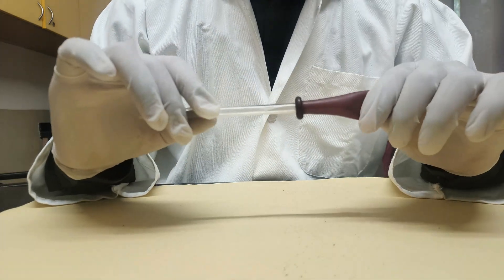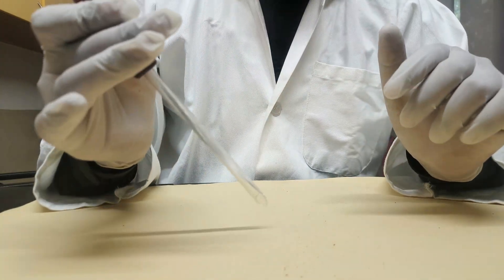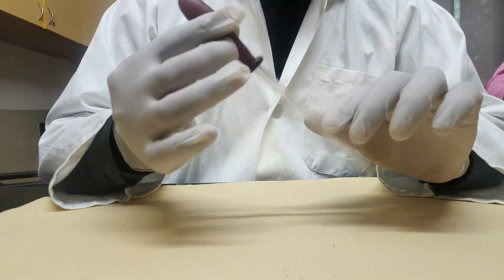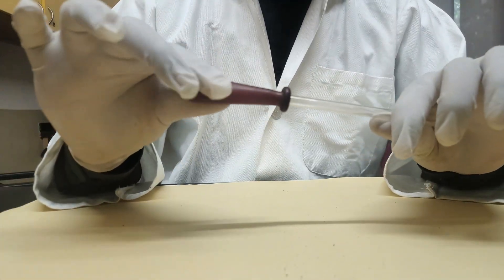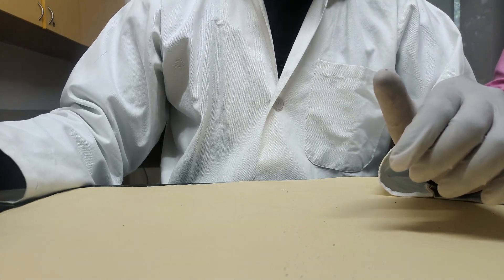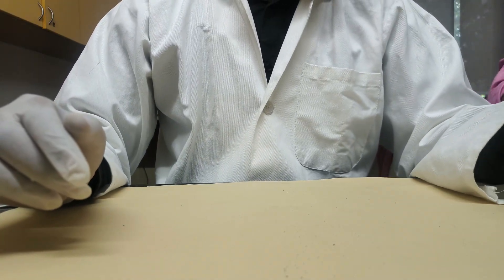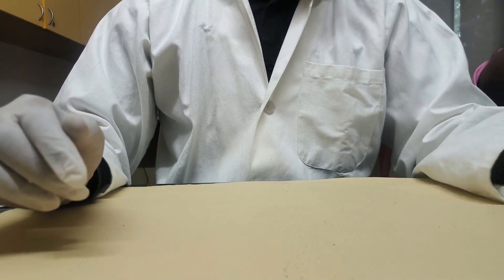Next item is the dropper, or we can call it a pipette in IGCSE. It is used to take out any chemicals drop by drop, and it is very helpful in the lab when dealing with any type of concentrated or liquid acids.